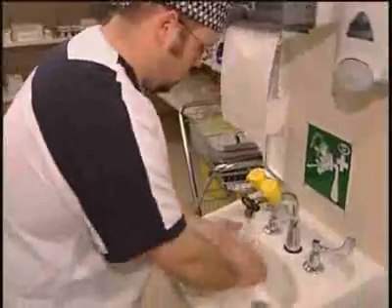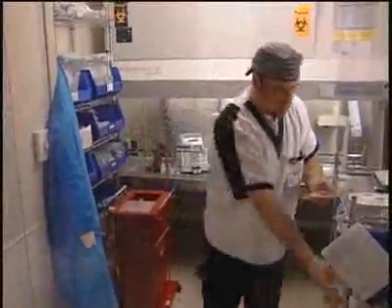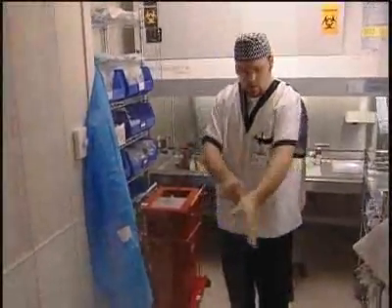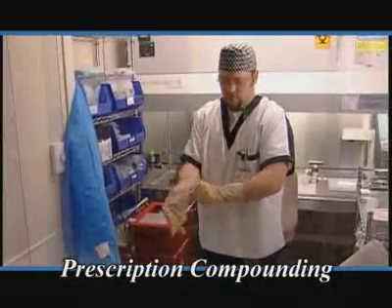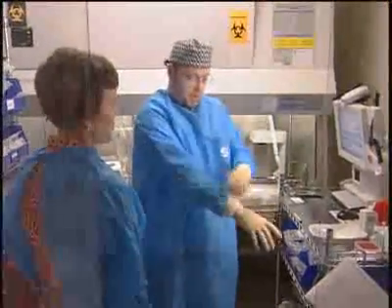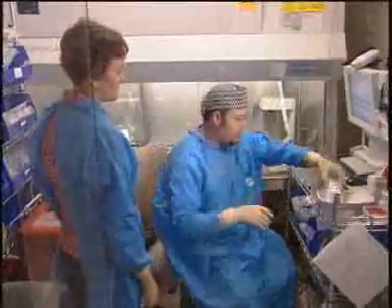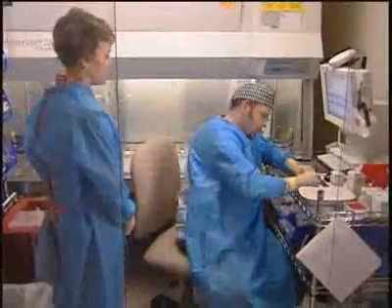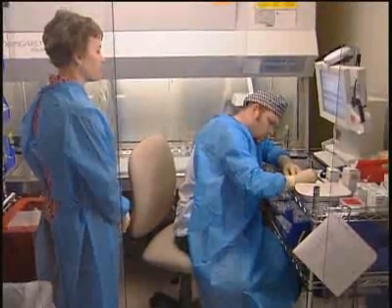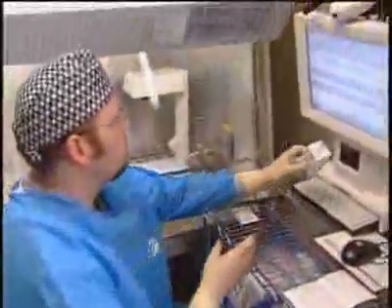Here I will wash my hands. Now I will put my gloves on and gown up in preparation for compounding a chemo. Hi Will, I see you're all scrubbed and gowned now. Yes, getting ready to fill this prescription — will you walk me through each step of the way as you compound it? Sure, I can do that. First, what we will do is sit down here, pull my drug out. I will go ahead and fill out my label here, do any calculations that I need to do, and note any expiration dates.